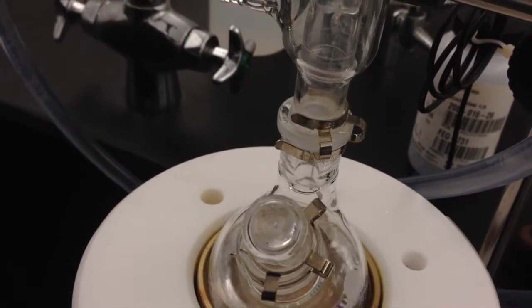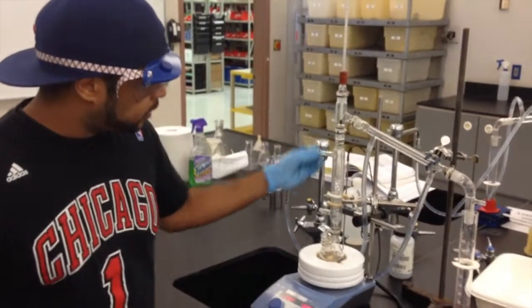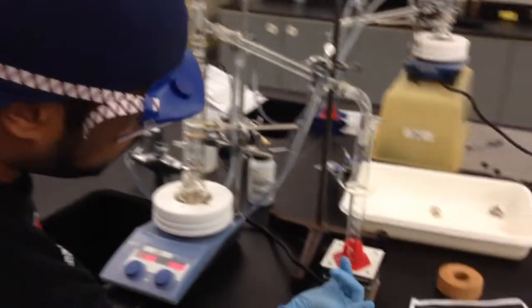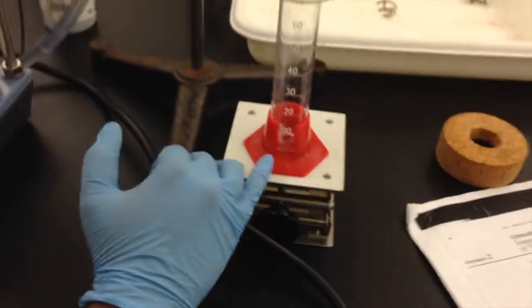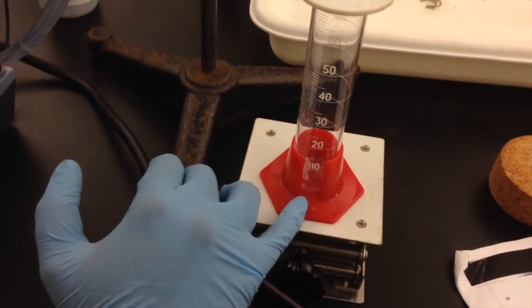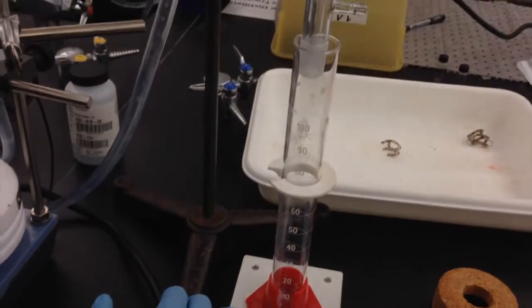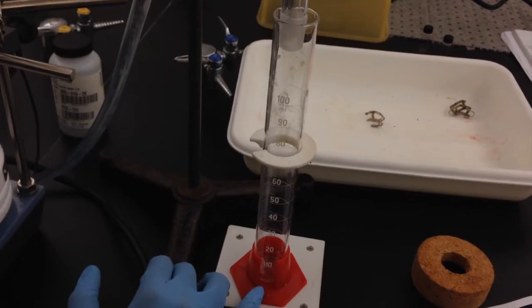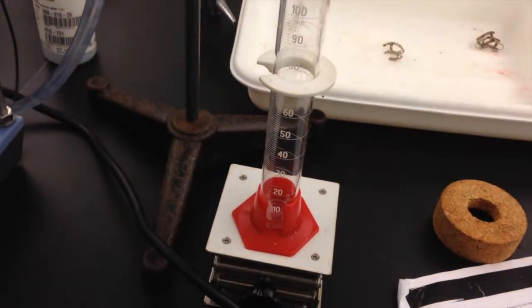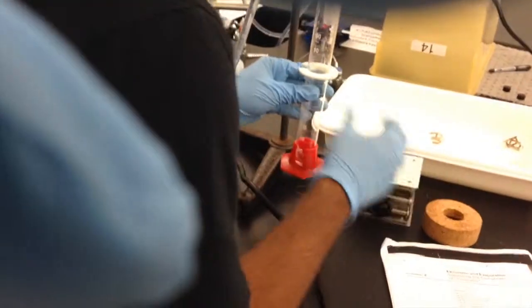test tube for collection. We're at the fractional distillation right now, and as you can see, everything's starting to work. At the bottom of our collection graduated cylinder here, we can actually see a couple of drops coming. Now, for us to get the first sample for our GC, we want to get the first 20 drops. So right now we're at about 14, 15, 16, 17, 18, 19, and 20. Now we can stop collecting here and get another flask.